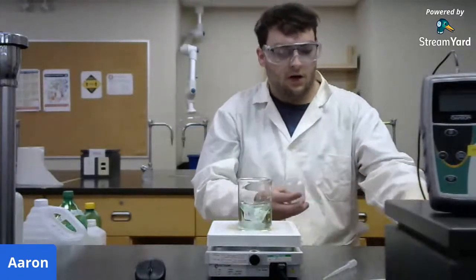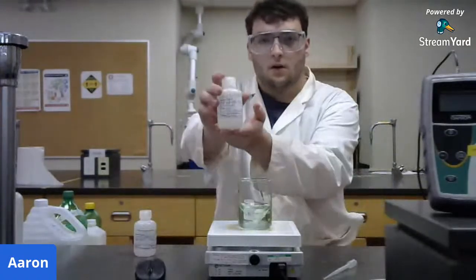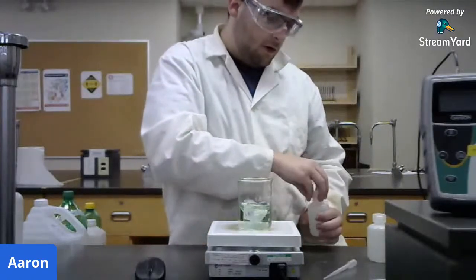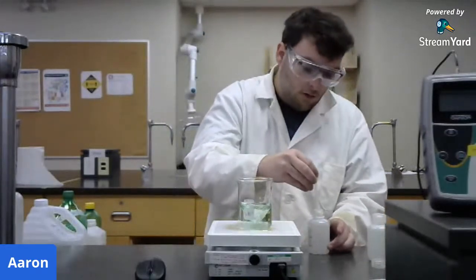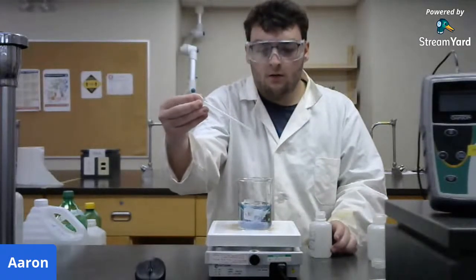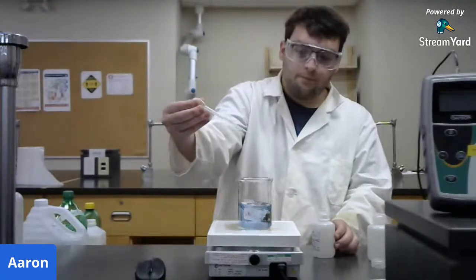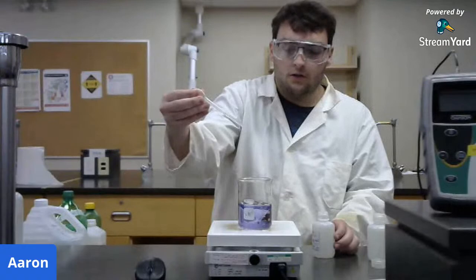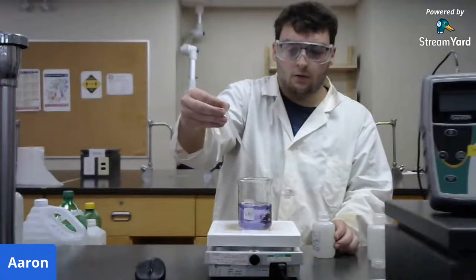So also I have here with me some sodium hydroxide and some hydrochloric acid. You can see our beaker here, a light green color. So we're just going to take some of the sodium hydroxide here, I'll take it in a dropper, and I'm just going to add just a couple drops. And you can see that the color changes almost immediately. If we add a few more drops, we can get even more color change to purple. So you can see it went from green to blue to purple.